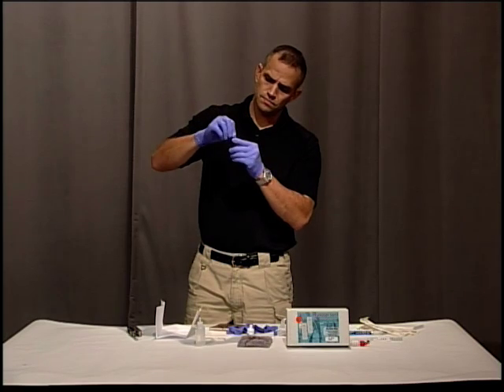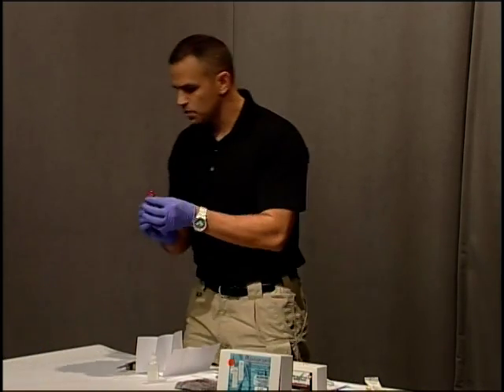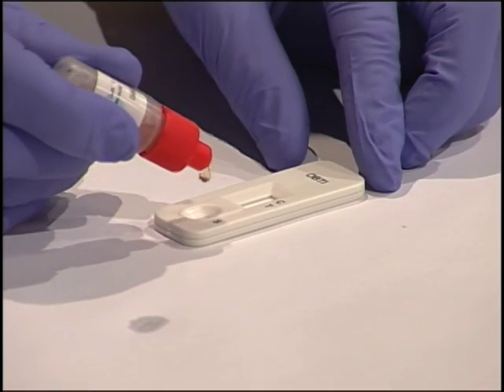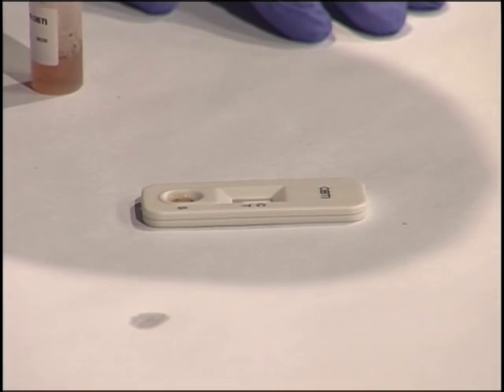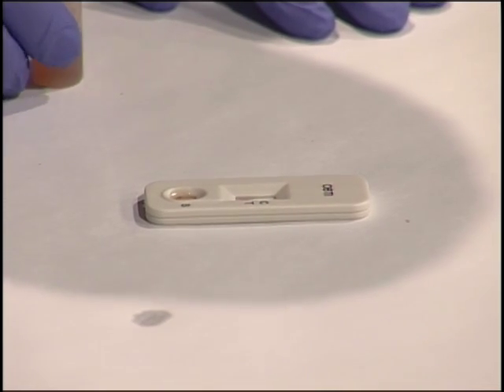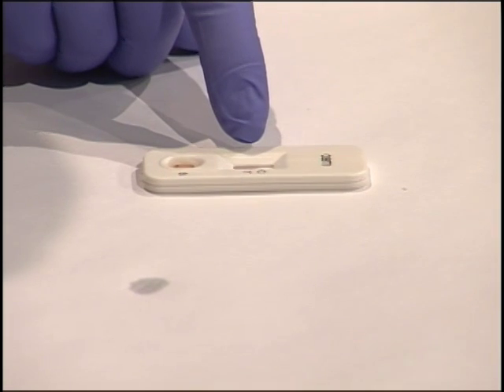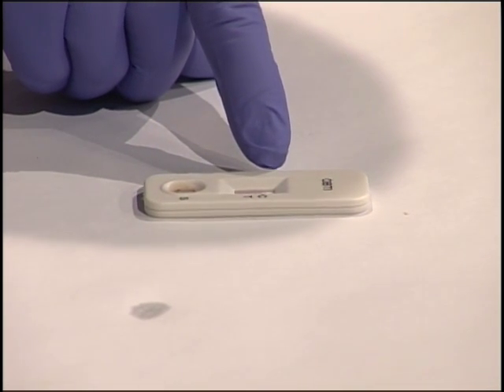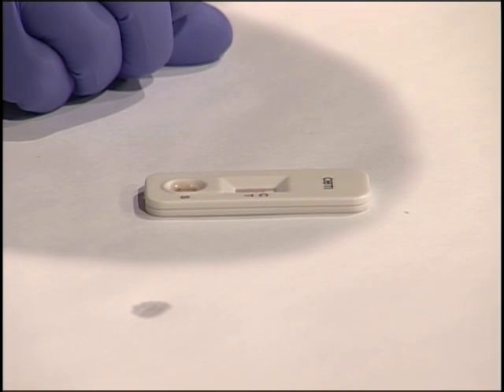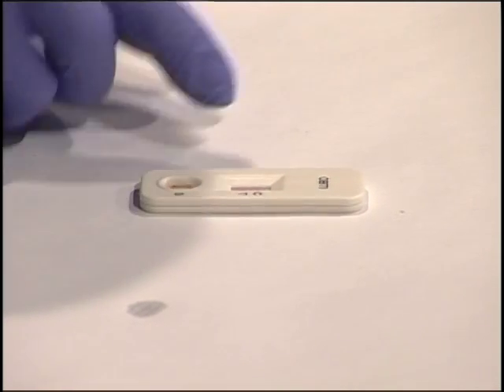We're going to break the tip off here — it's now open. You're going to put exactly three drops into the sample area. That's going to soak up; you can see it coming along the top. After waiting a few minutes for it to soak all the way up, you can see the test is coming up with a line, and so is the control. There are two lines, so that's a positive test. The blood that I scraped and mixed in there is testing positive for human blood.